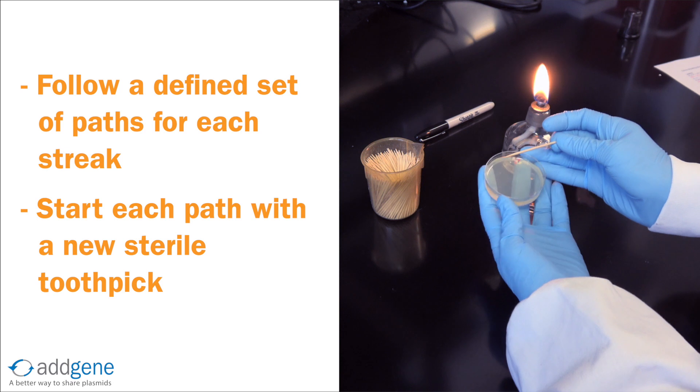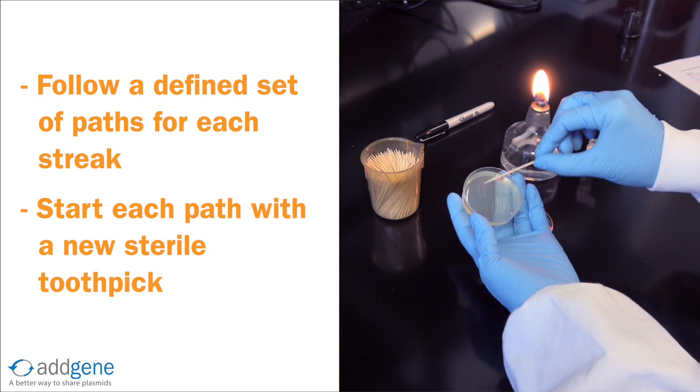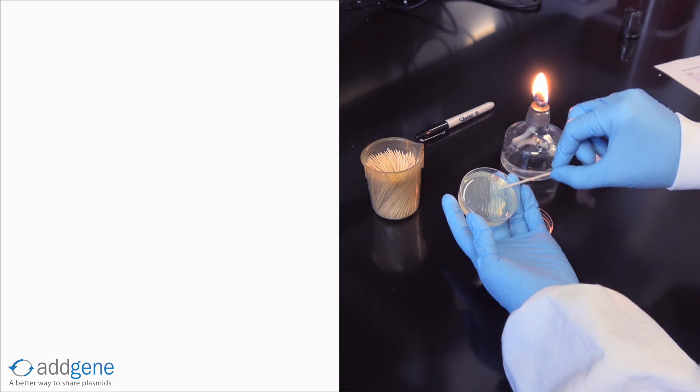We then repeat this process one final time with a third sterile toothpick. Although we must be careful, the whole process can be performed quite quickly.